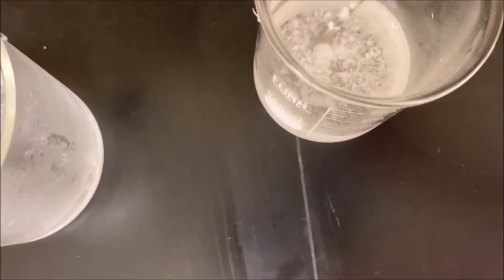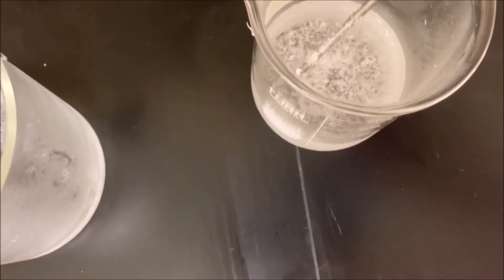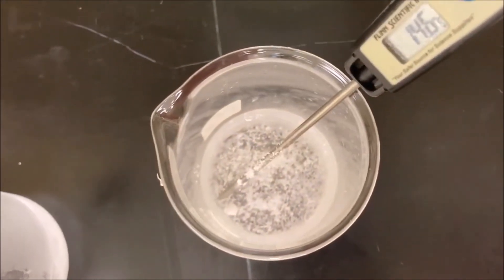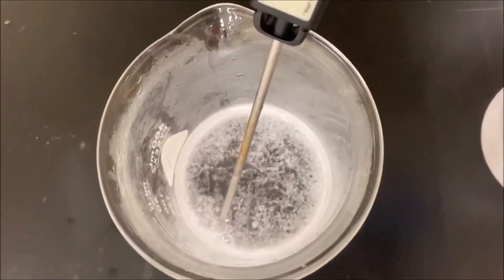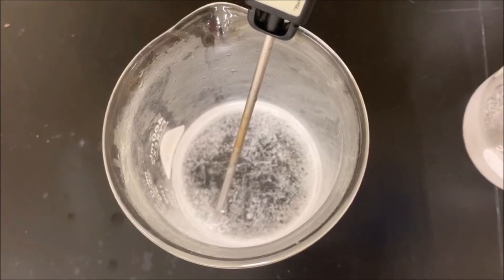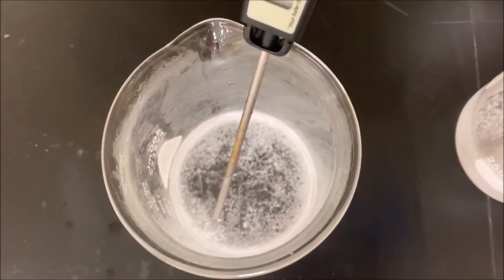We still just see this mixture of the glacial acetic acid with the sodium carbonate, and then here we have the two things mixed. Got a little tiny bit of bubbling. Nothing else.